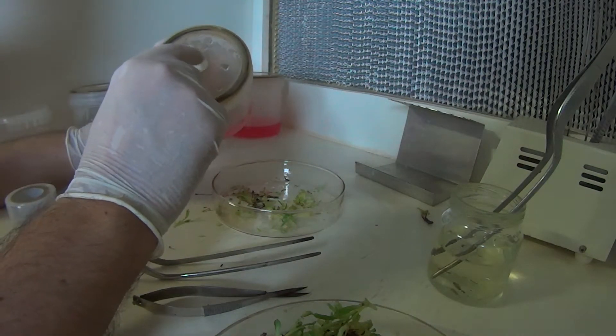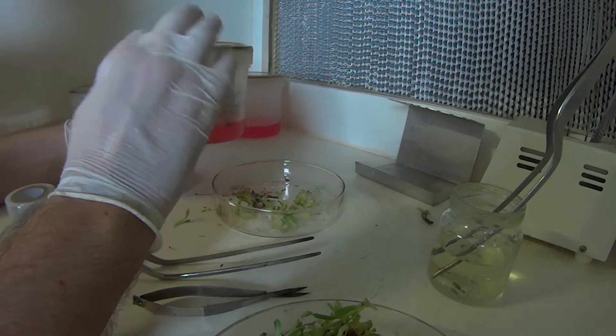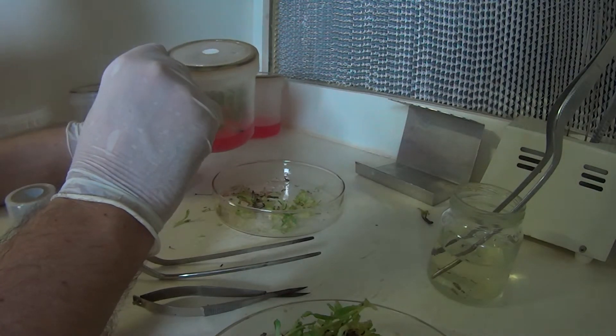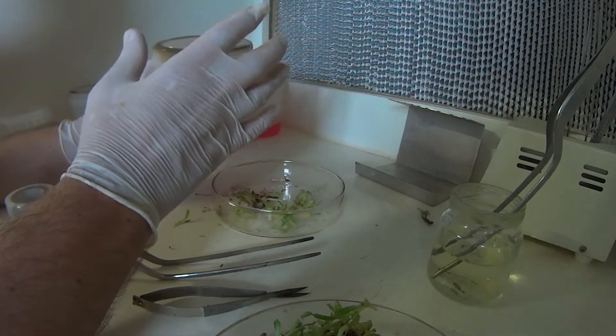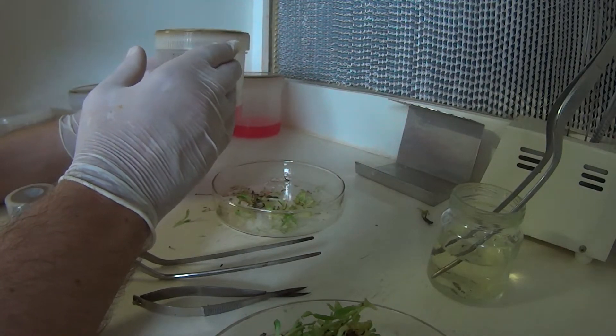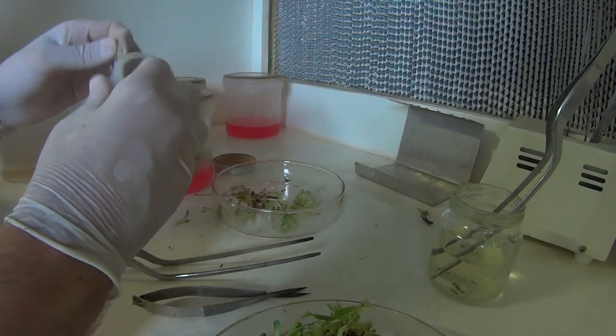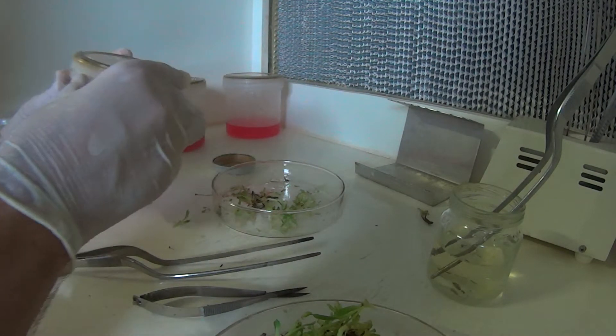These vent spots do last for quite a while, you can pressure cook them, sterilize them with the vent spot in place as long as the lids aren't on tight otherwise you can tend to pop the vent spot off. And all I do now is once again seal them up with the sealant film.